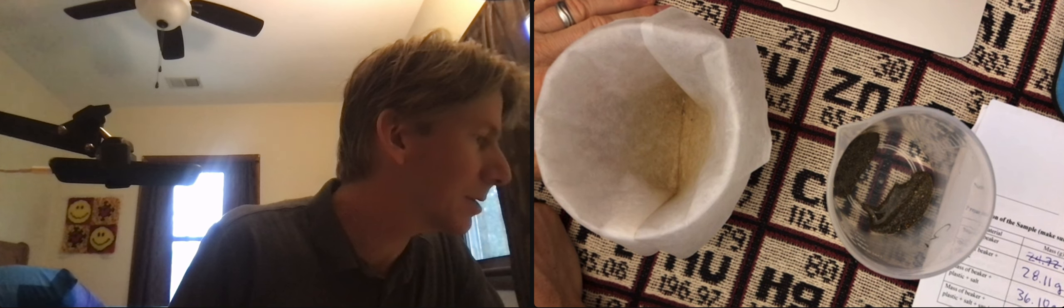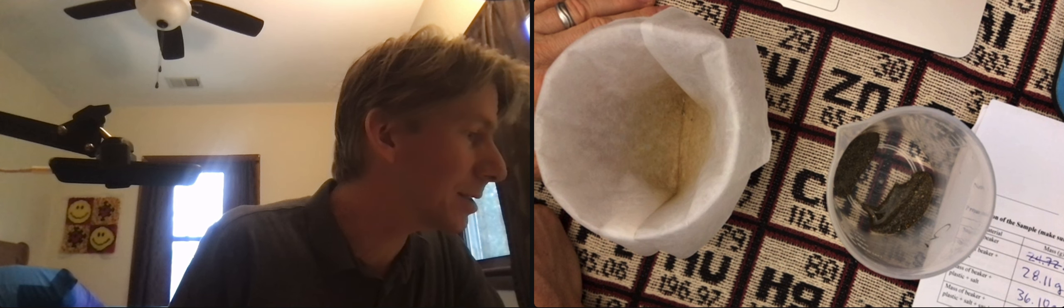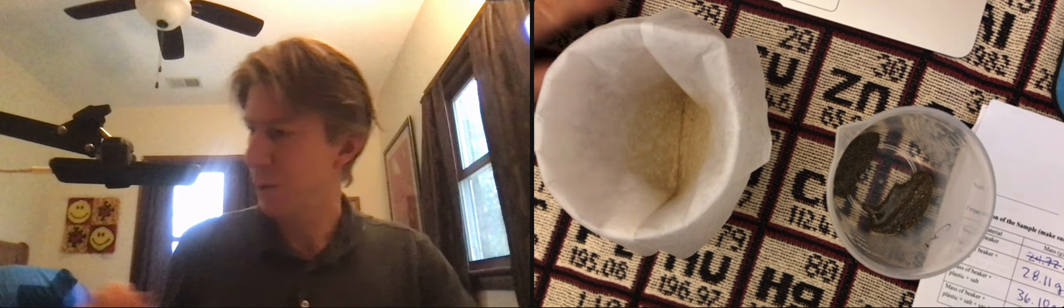Next step is going to be to add 50 milliliters of water to the 250 milliliter beaker. Stir until it is well mixed. Pour the solution.